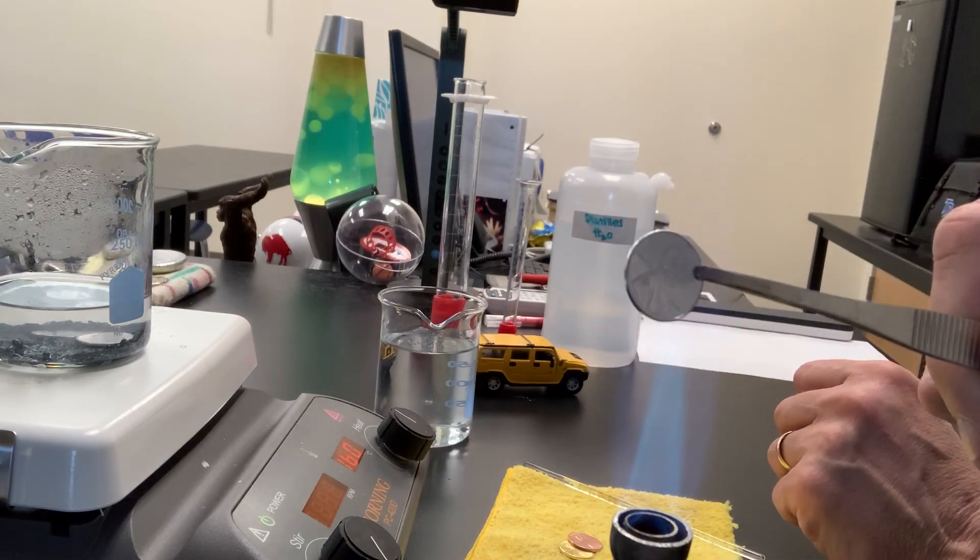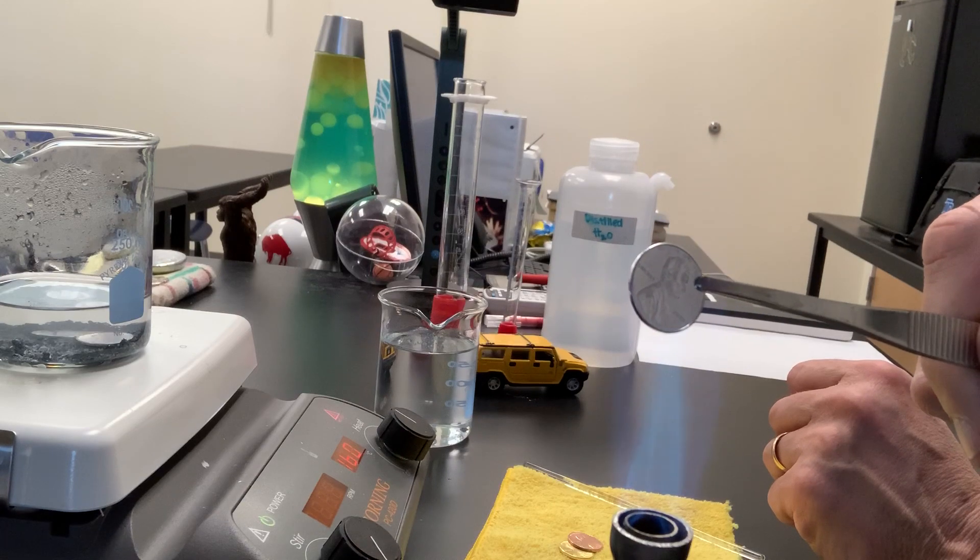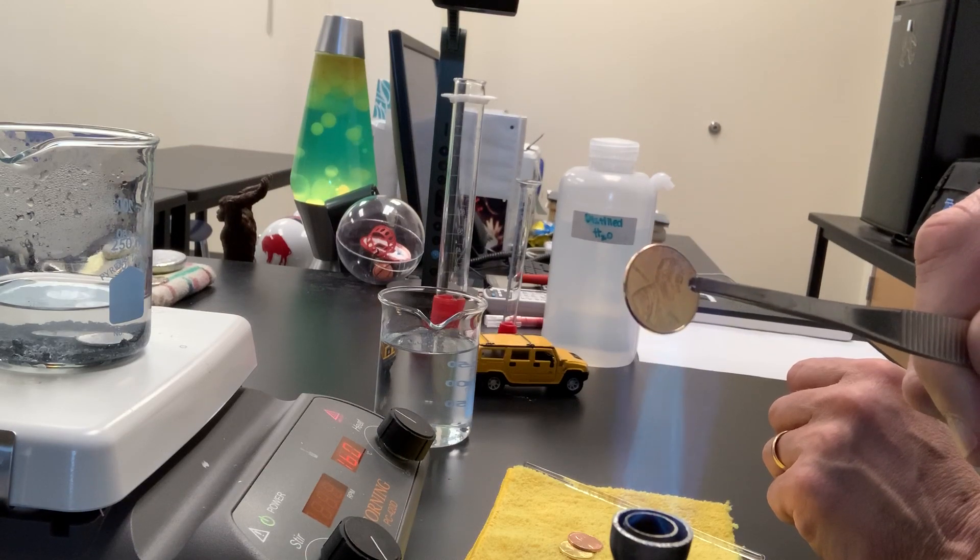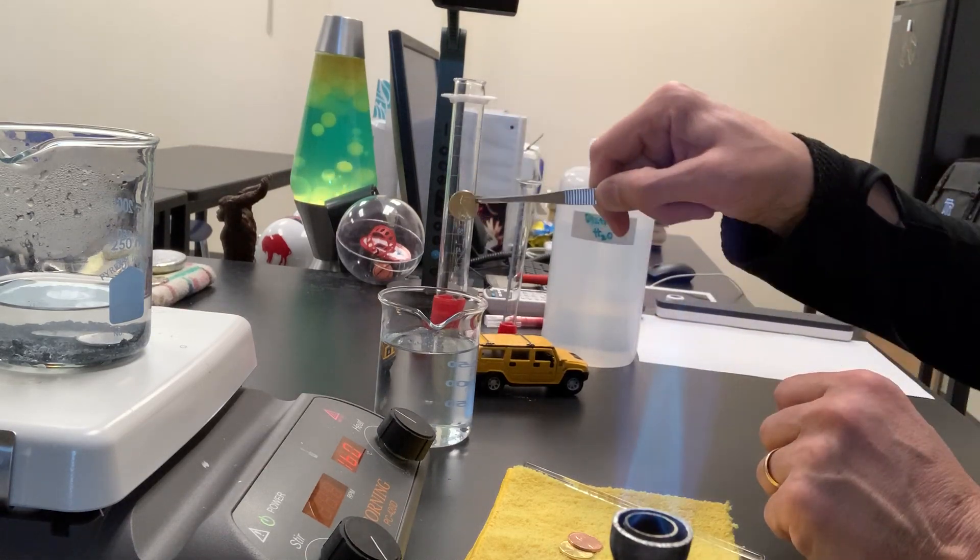As soon as we see a color change, I'm going to take it out of the flame. I'm not sure if you can see that change or not. We'll quench that.